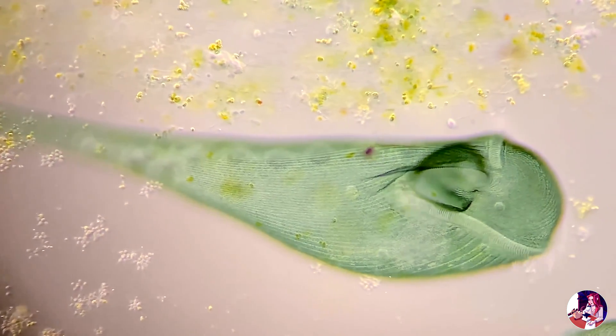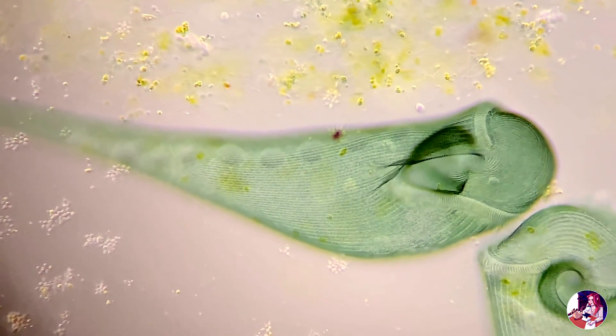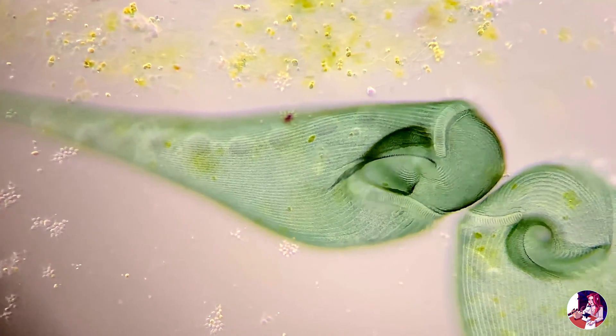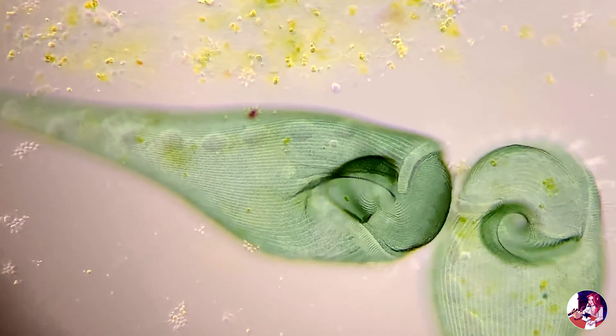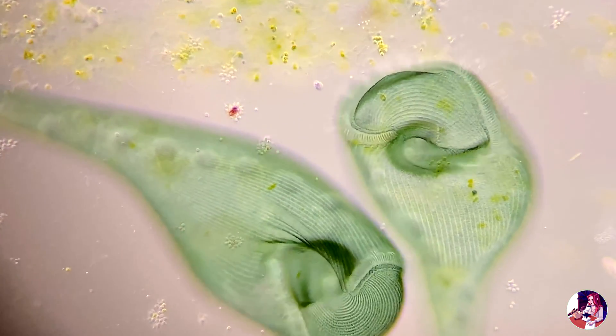Stentor coeruleus are among the most admired and popular ciliates around, measuring approximately 1 mm, and can be observed with the naked eye.